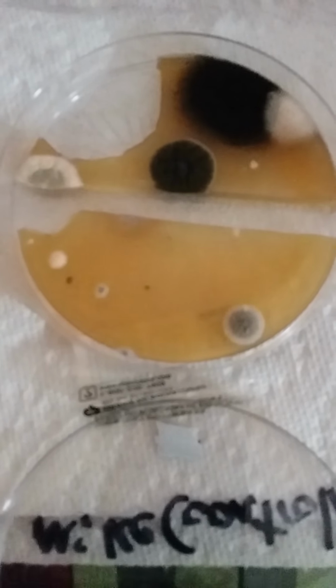That was because like day 3, I got the mold that's white on the outside and gray in the middle. By the time day 3 had come, it was already the size that you see cut out at the top left, and on the left side in the middle you'll see a notch cut out where it had cross-contaminated from there. So it's very important that you use the correct media.